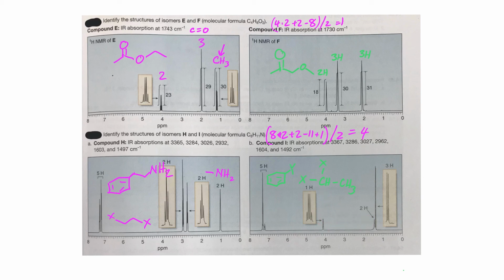And then I have what looks like 2 signals very close in chemical shift. A 2 hydrogen singlet, and then a 3 hydrogen doublet right here. This 3 hydrogen doublet is very likely that methyl group, because we would expect that methyl group to be a doublet. It's only adjacent to one H. And thus the 2 H's that are remaining most likely is another NH2 group. So now I have all my pieces laid out. I have one way to attach an NH2, I have 1 attachment point on my benzene ring, and I have 2 attachment points on this group here. I don't know what to call it, but I think I can draw my structure now.